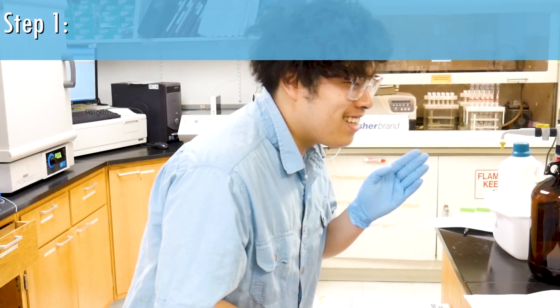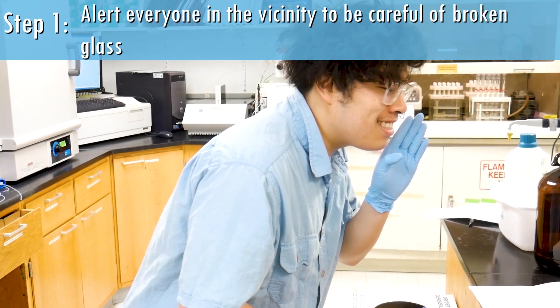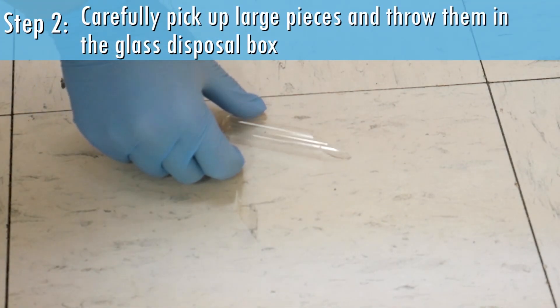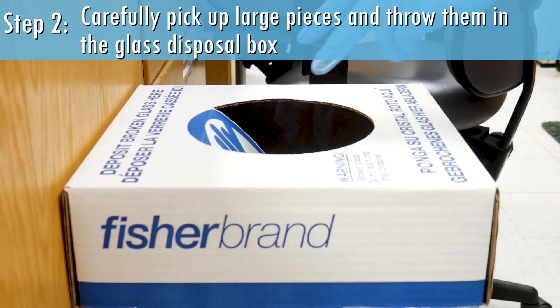Next, we will discuss what to do if you break a piece of glassware. Step 1: Alert everyone in the vicinity to be careful of broken glass. Step 2: Carefully pick up large pieces and throw them in the glass disposal box.